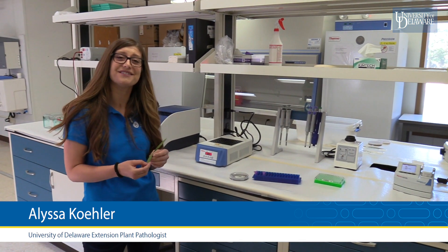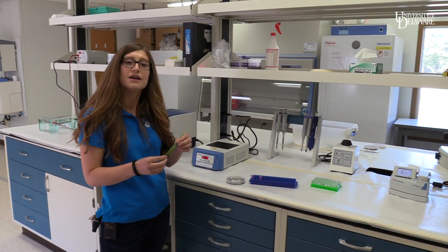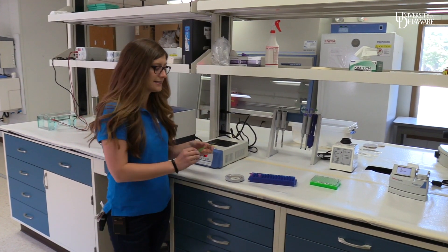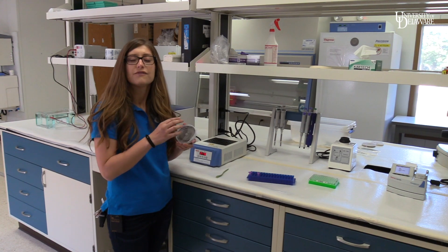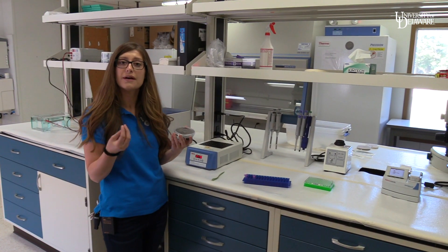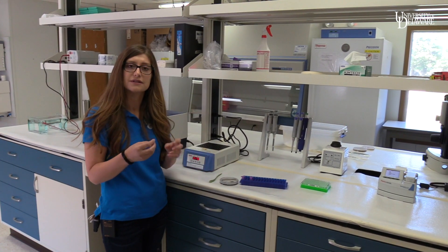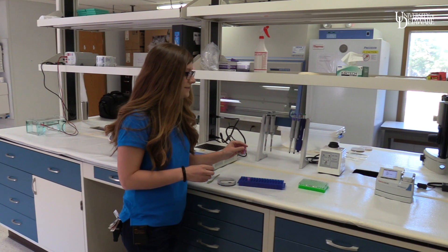In addition to diagnosing things out in the field, we're able in this lab to diagnose things using molecular techniques. We start with the symptomatic plant tissue and then try to isolate out the organism that's causing disease. In this case it's a fungus, and we grow out some of that fungal tissue and go through a process of extracting the DNA.